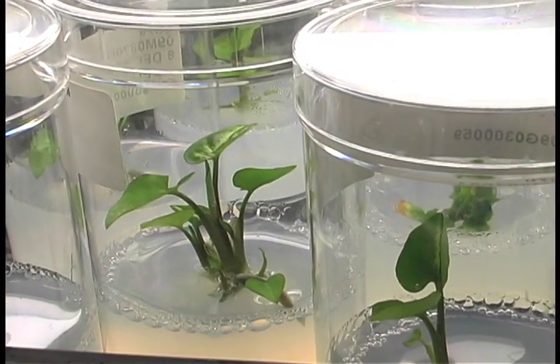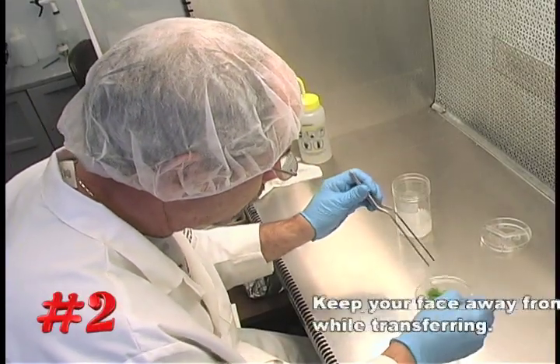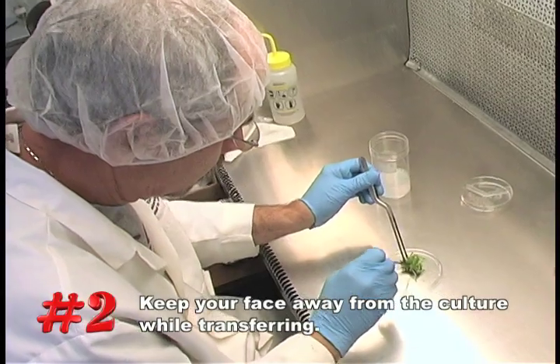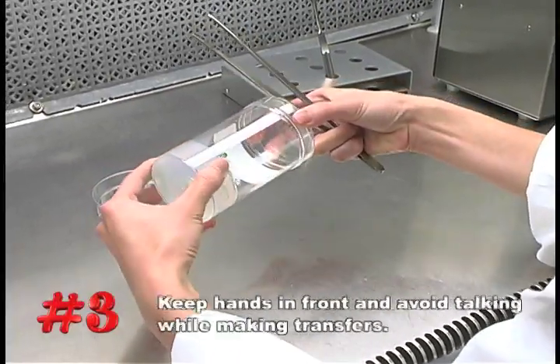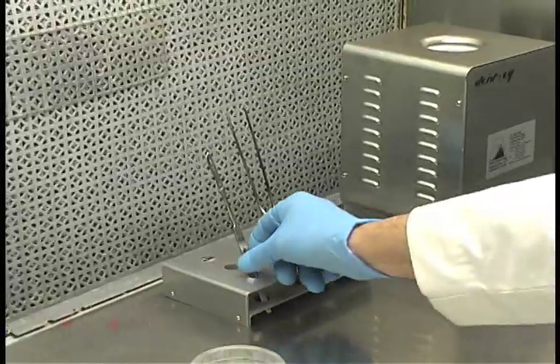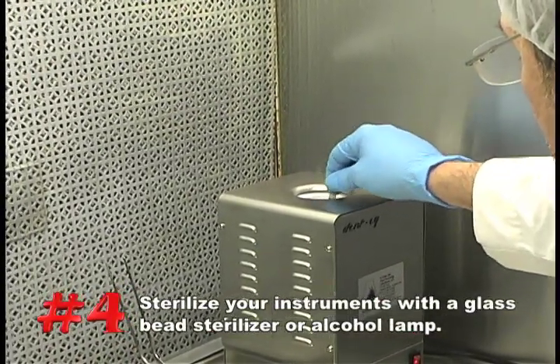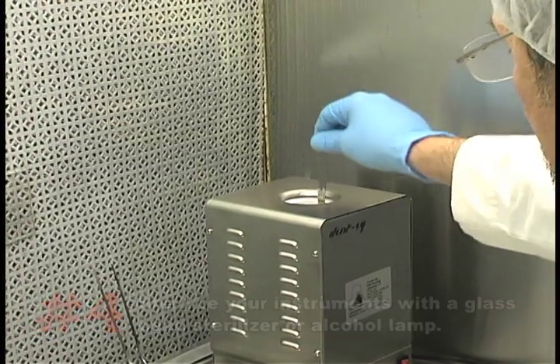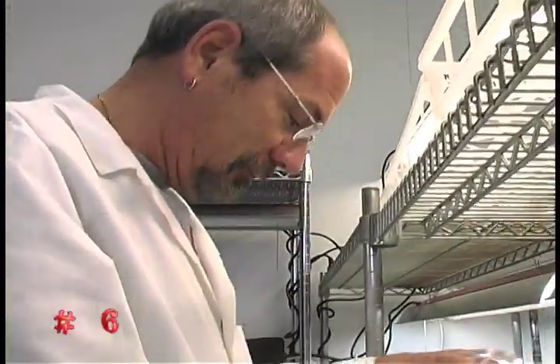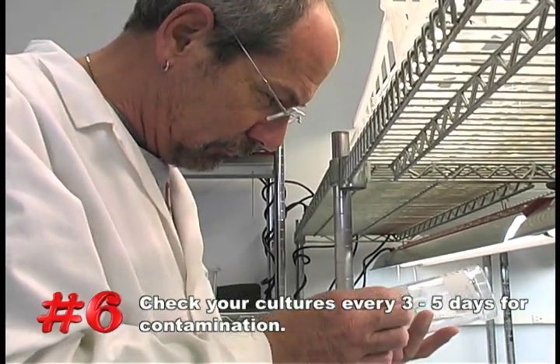To recap: 1. Always spray or wipe down the transfer area approximately 30 minutes prior to work. 2. Always keep your face and head away from the cultures you are transferring — remember that most contaminants are introduced through poor technique. 3. Work with your hands in front of you and avoid talking with others around you when making sterile transfers. 4. Use a glass bead sterilizer or alcohol lamp to flame your transfer instruments between transfers, and remember to allow the instruments to cool between transfers. 5. Keep your transfer area clean and uncluttered. 6. Check your cultures every three to five days for contamination and discard all contaminated cultures to prevent cross-contamination.